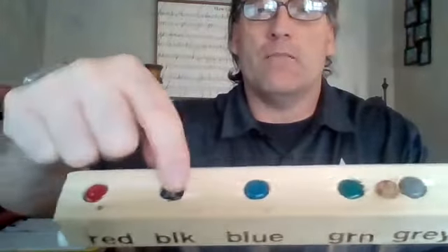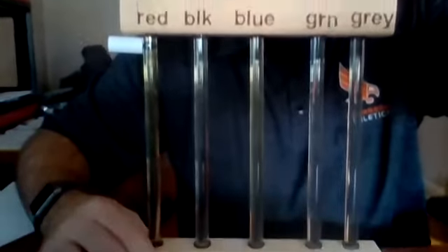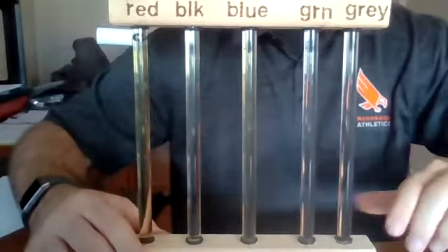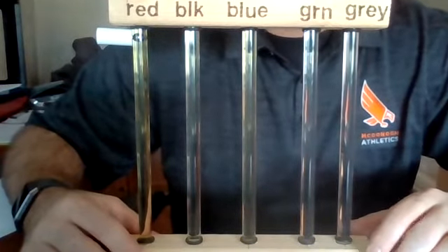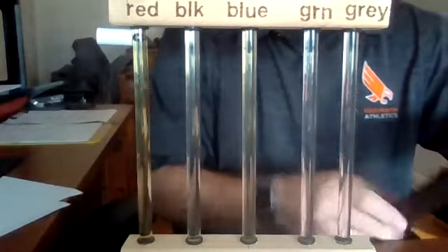There are different colors representing the different colors of the tabs: red, black, blue, green, and gray. So that will relate to your lab manual. In your lab manual, you will also have an area to record down the times. And so we're going to do 5 trials for each of the 5 colors, get the average, and then create a comparative bar or column graph based on our data that we're going to be collecting right now.